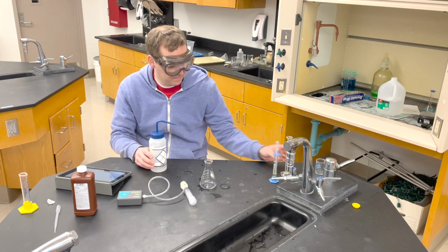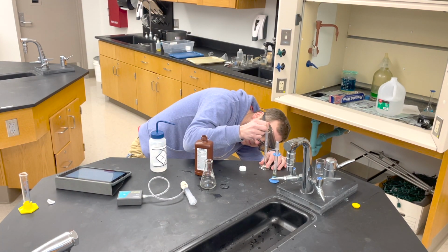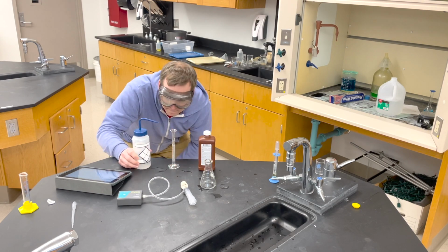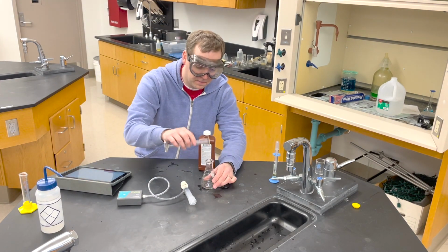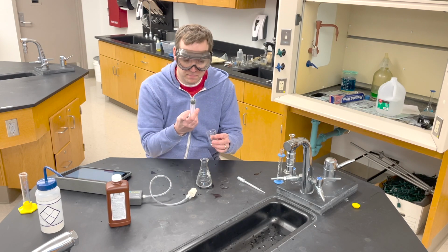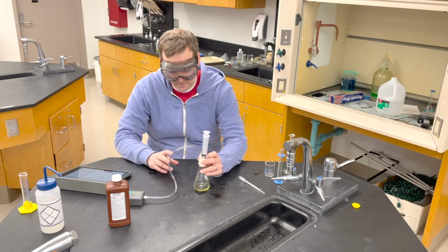Finally, in this last experiment, the procedure is once again the same, but this time I'm going to use half concentration of hydrogen peroxide. So I measure out 4 milliliters of the hydrogen peroxide, then I go ahead and add 4 milliliters of water, leaving me with 8 total milliliters of diluted hydrogen peroxide. Then I go back and measure out 2 milliliters of the original 0.5 molar potassium iodide solution. Here I am, grabbing that KI, putting it on, mixing them together, give it a quick swirl, and collect data.